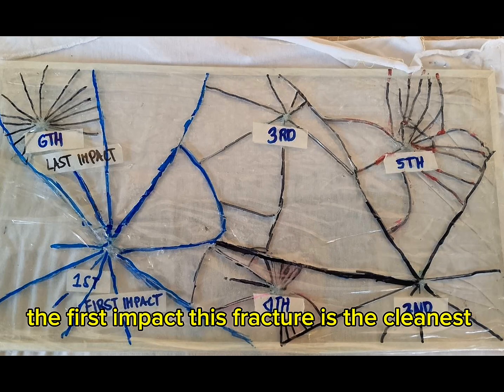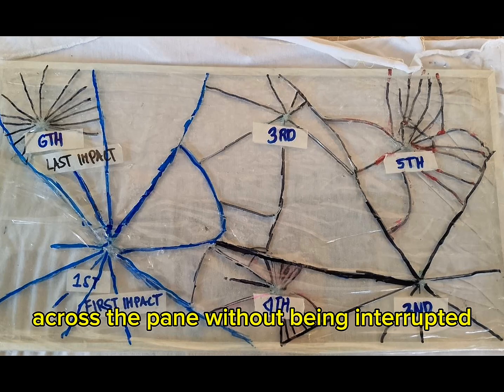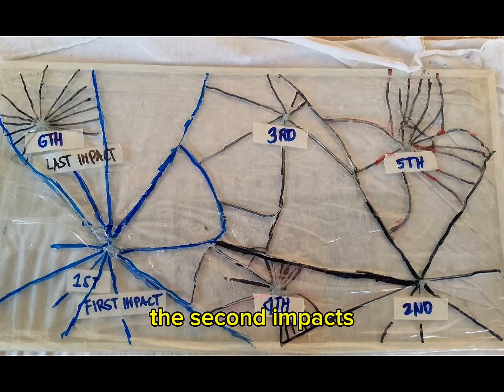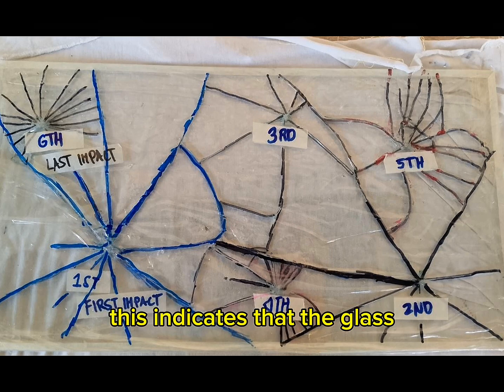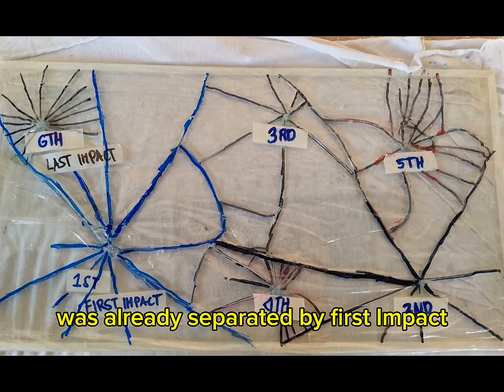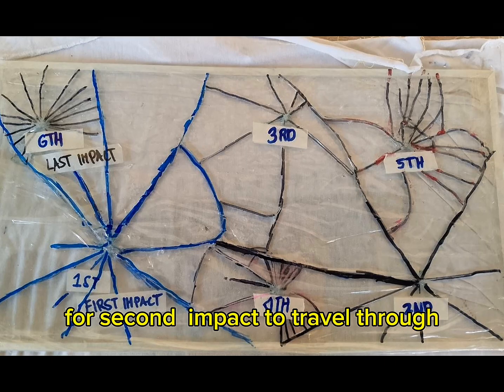The first impact, this fracture is the cleanest. Its radial cracks extend across the pane without being interrupted. The second impact's radial lines stop abruptly when they hit the cracks from the first impact. This indicates that the glass was already separated by the first impact, leaving no continuous medium for the stress from the second impact to travel through.